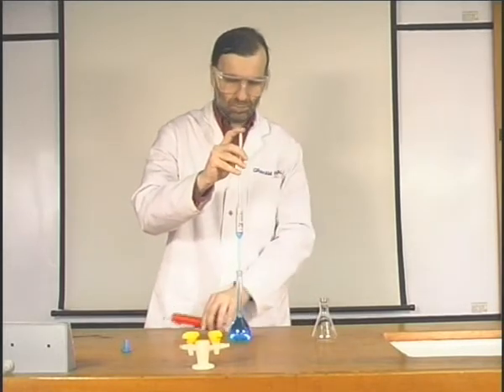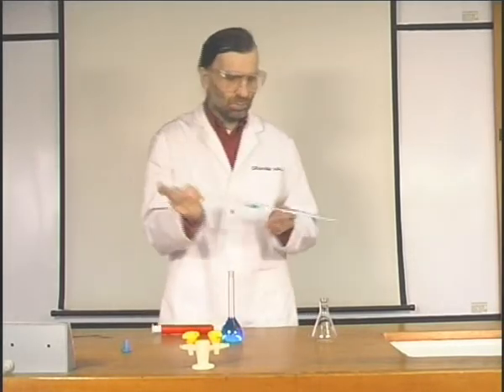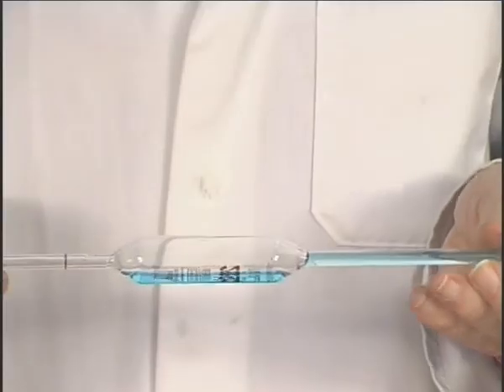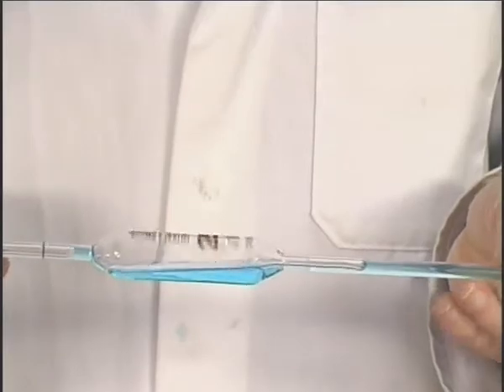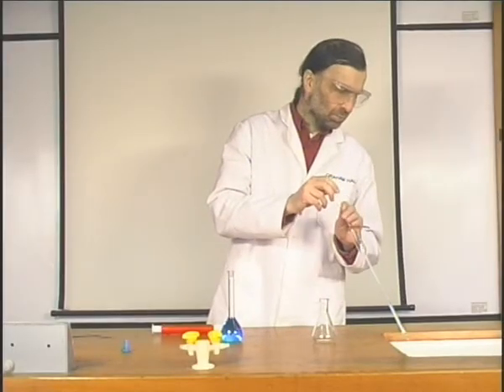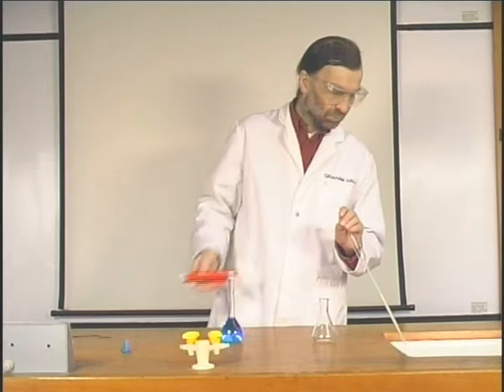The filler is removed and the pipette is rotated so that the liquid coats and cleans all of the surfaces. This washing liquid is now discarded into a sink or into a waste beaker.